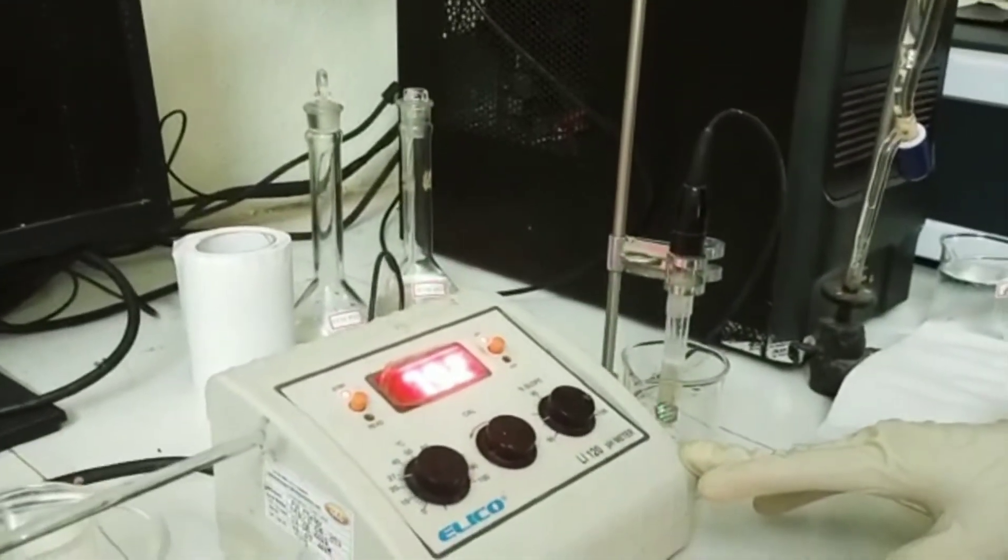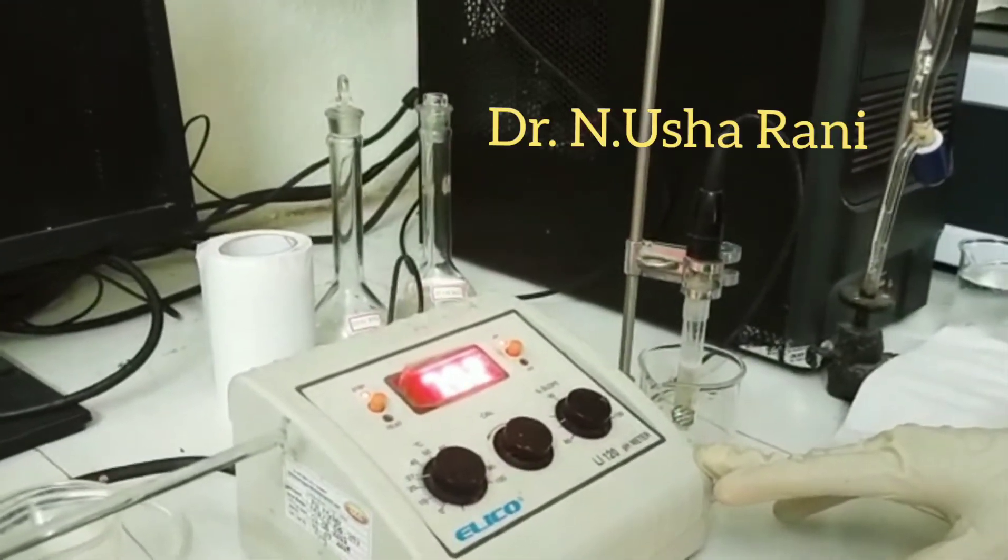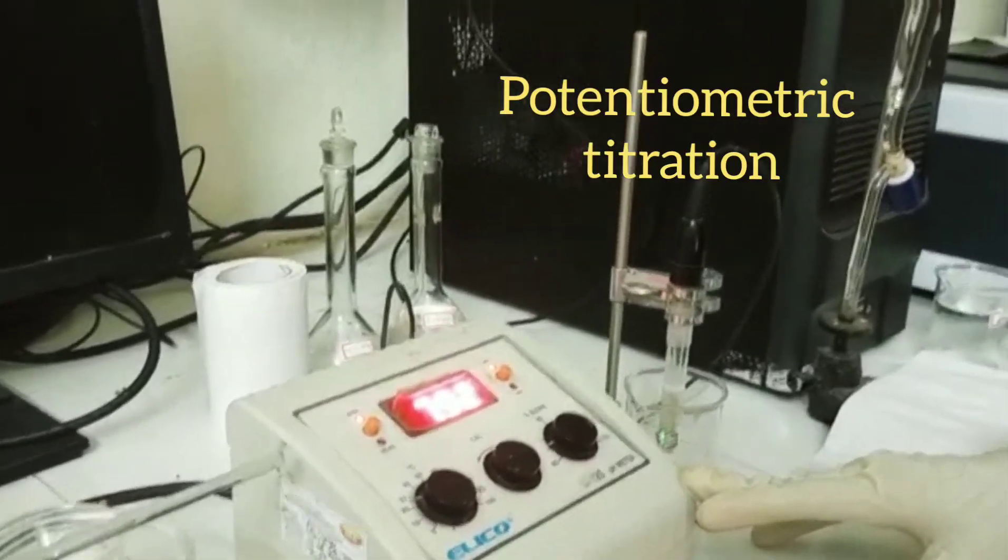Hi everyone, this is Dr. Nusharani. Today, I want to demonstrate potentiometric titration.